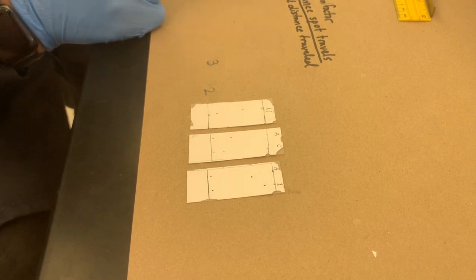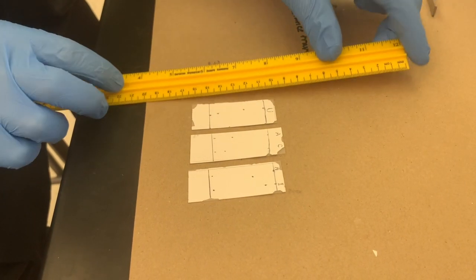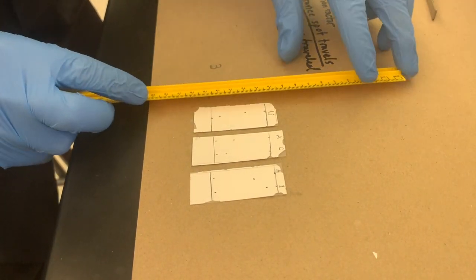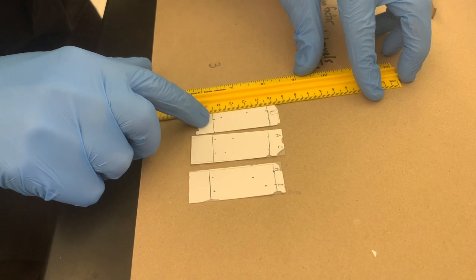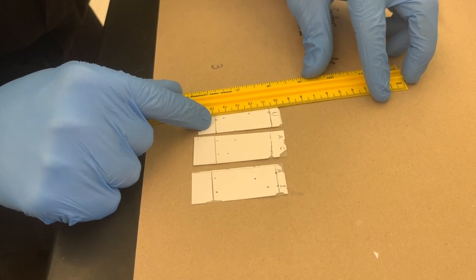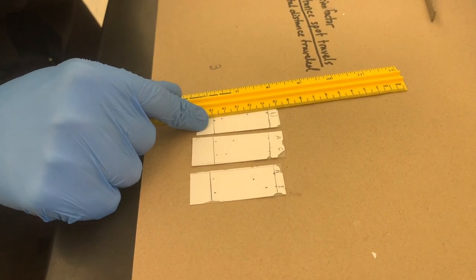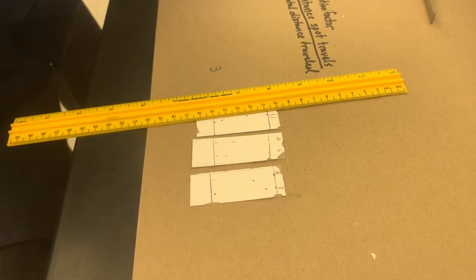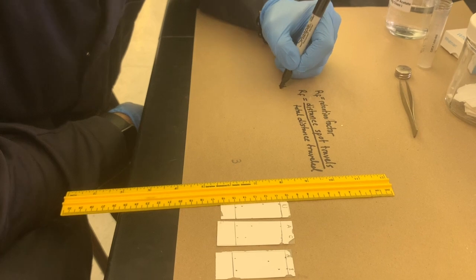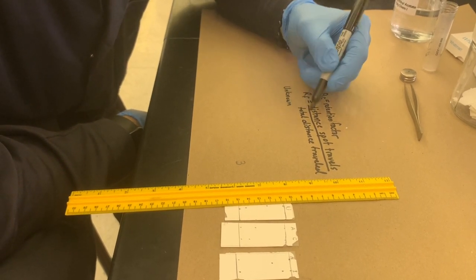We're going to work in centimeters because we work with a metric system in this house. We will look at these distances based on the original spot point, which can be easy to find if you look in the silica for where you may have touched it or dug in with your capillary tube. We're going to take our spots and measure them out. For our unknown, spot 1 will be the lower spot.